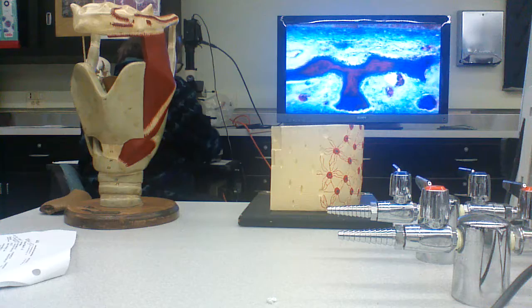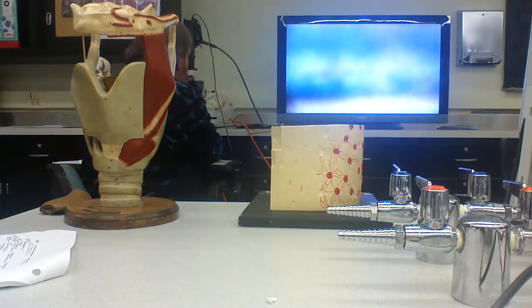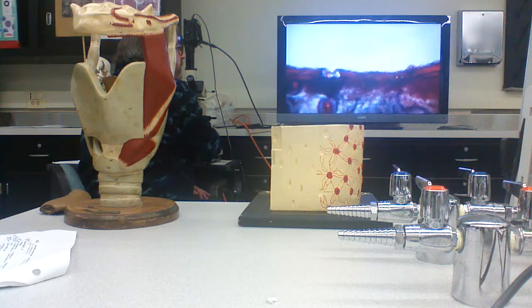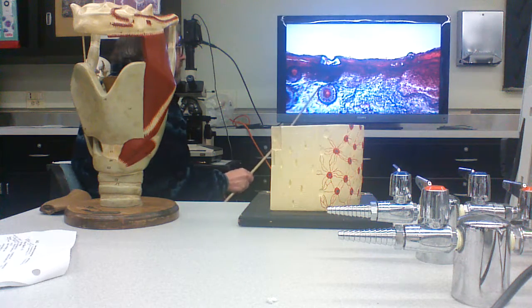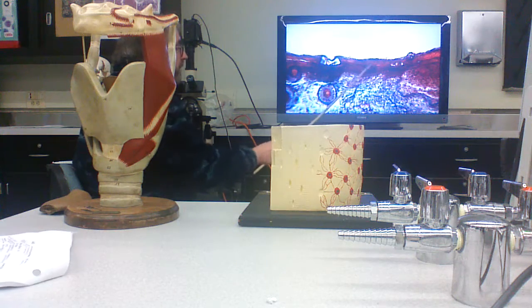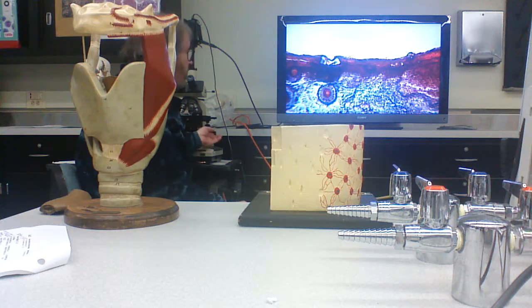So, here's what happens. Here's the skin of the head region. It's mammalian because this is a hair follicle, as we'll learn as the course goes on. Here's your stratified squamous epithelium. I'm not sure it started keratinized in this preparation.